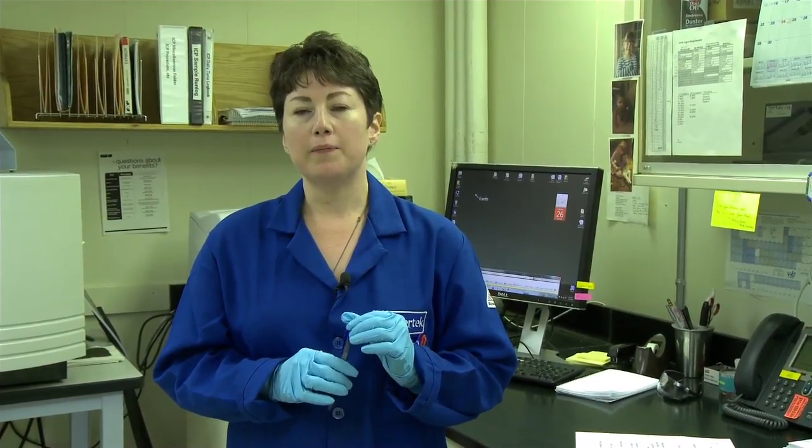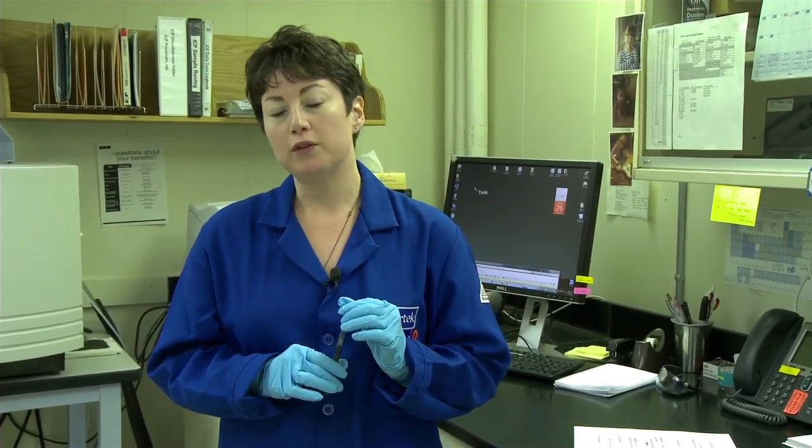My name's Heidi, and in the metals section, we're running ICP-OES and also IC. ICP-OES is inductively coupled plasma optical emission spectrometry. We receive the sample. If it's an emulsion, we use an emulsion breaker and heat to break the water out of the sample. We then acidify the sample. The autosampler introduces it to the instrument, where it's nebulized into an argon plasma.